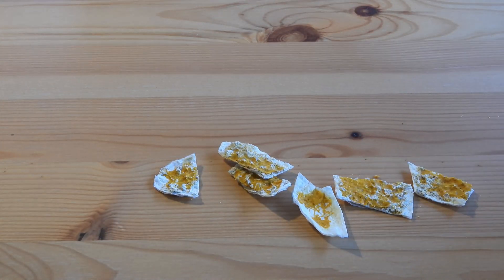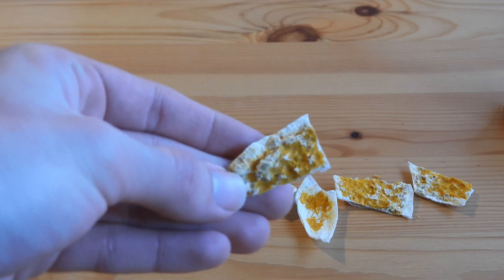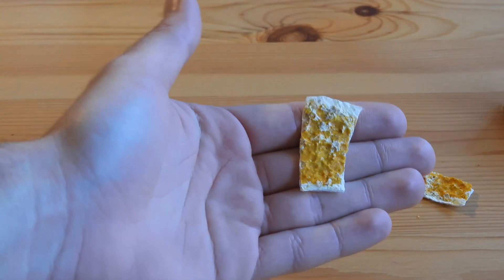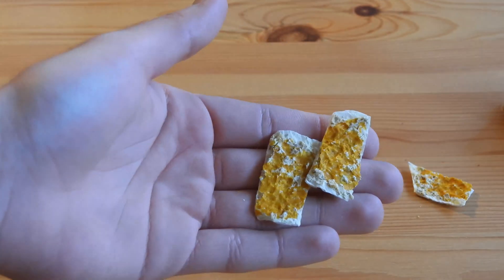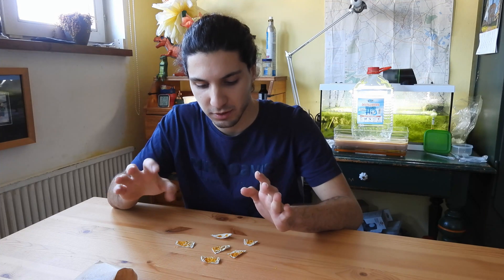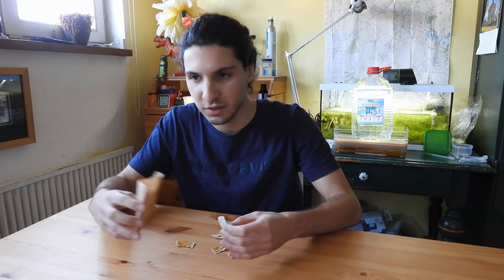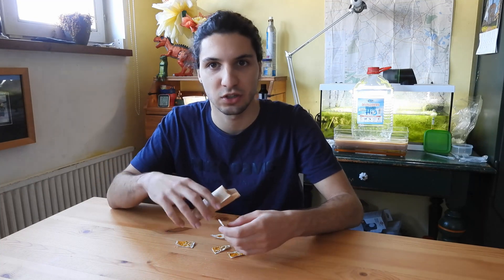The first thing you have to do to grow some Physarum is to actually get it somewhere. Here I have in this bag some material — you can see it's in the dry form. This is called a sclerotium, and the sclerotium is the almost hibernating state of the slime mold. It's almost like a frozen state — it loses most of its moisture and creates a resisting body where metabolism is pretty much stopped in time. You can store it in a paper bag almost indefinitely — at least more than a year — and it will be fine.